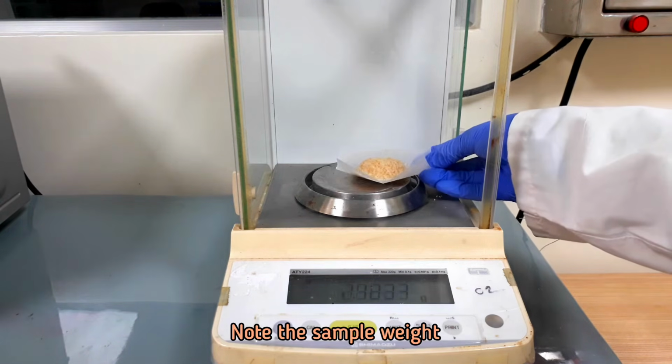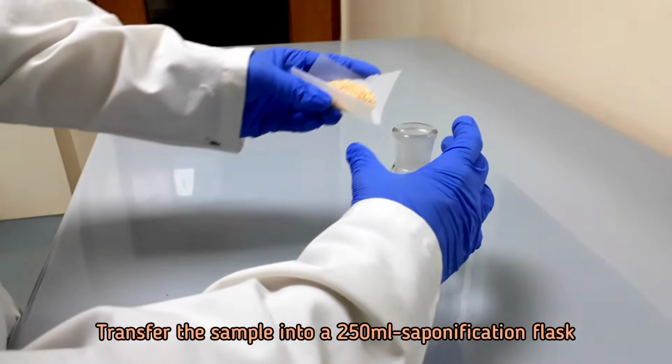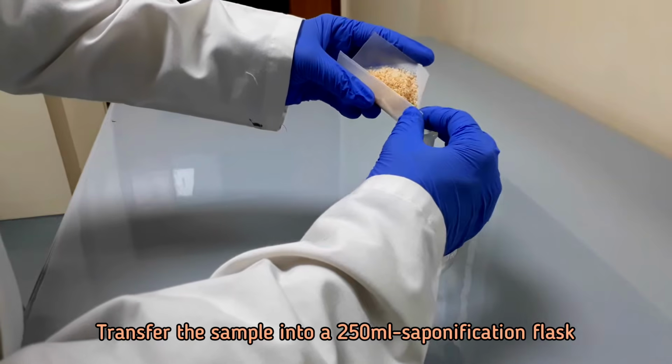Note the sample weight. Transfer the sample into a saponification flask.